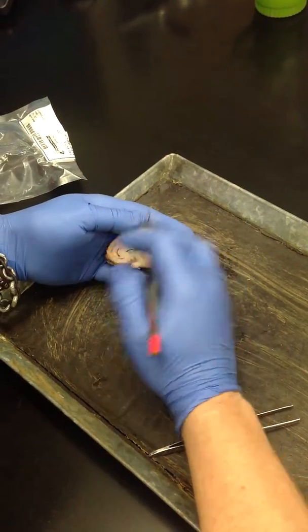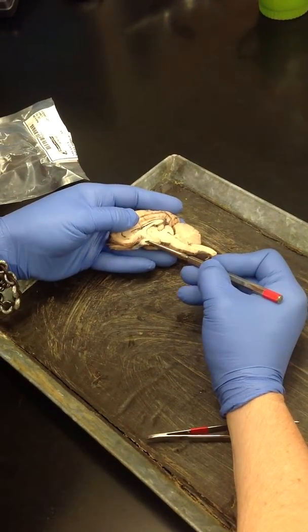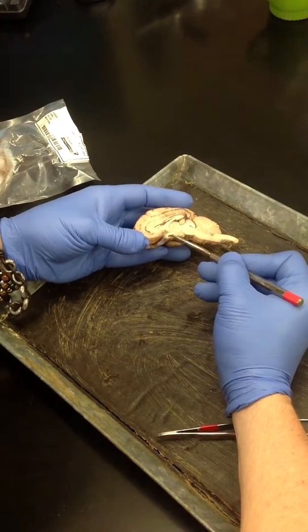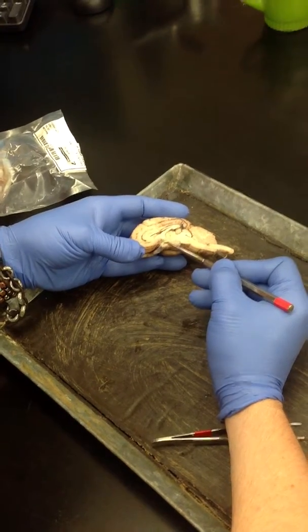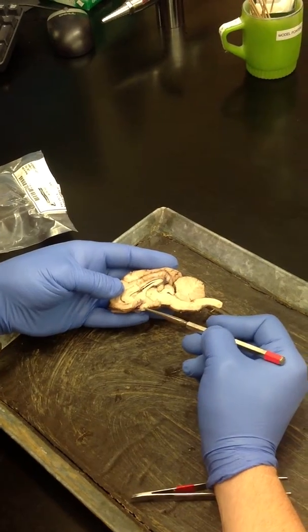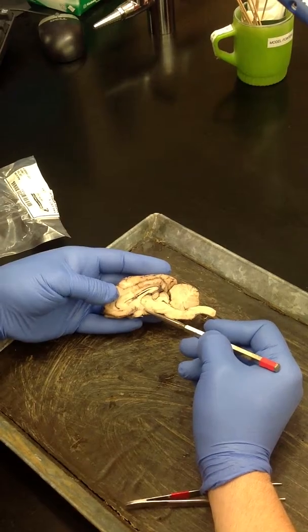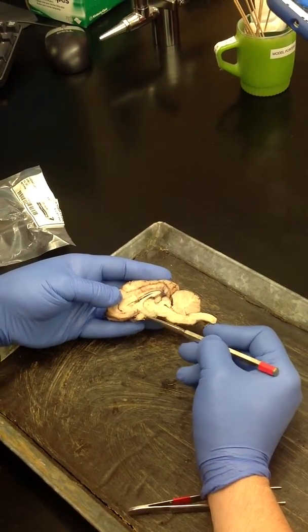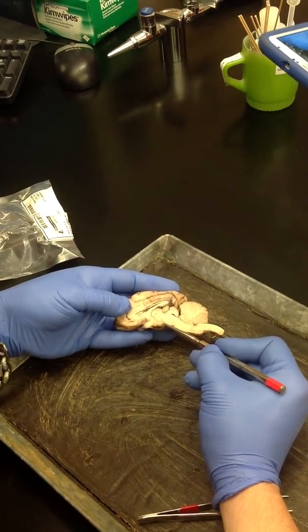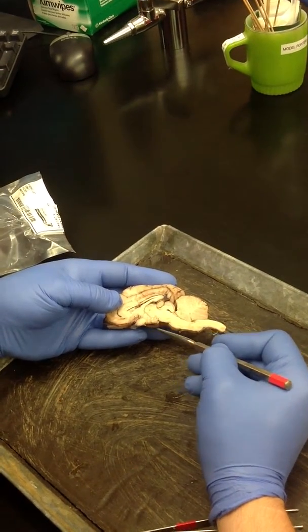I'll do the ventricles last. So then we come down here, we've got our optic chiasm, so optic nerve, and then where it crosses, optic chiasm. It's nice and white because those are just axons. I use that optic chiasm as a point of reference because when you find that and you come straight back, you're in the hypothalamus. Okay, so this is the hypothalamus. And in the hypothalamus, you have the mammillary body, which is this little circle right here. And then hanging off of the hypothalamus would be the pituitary gland.